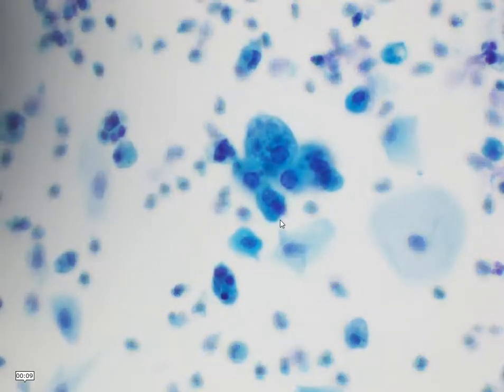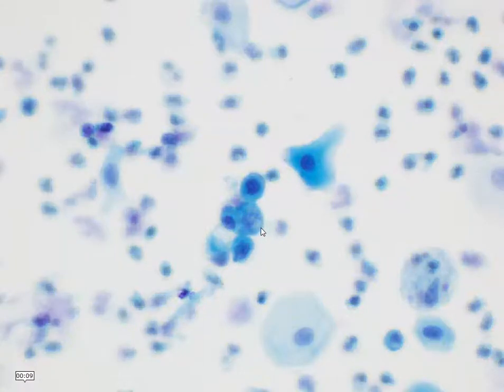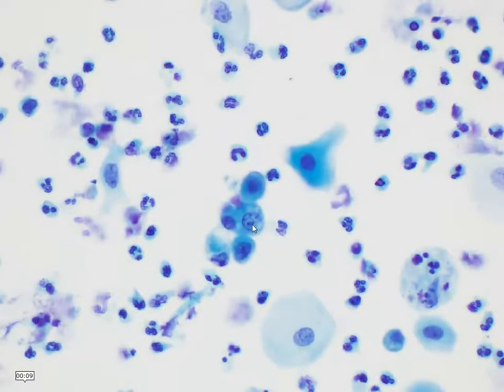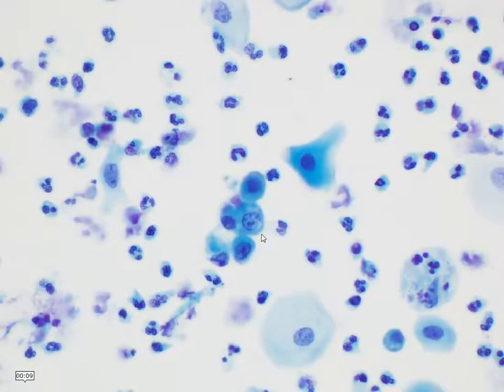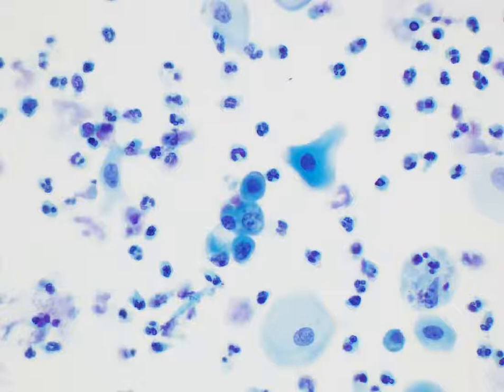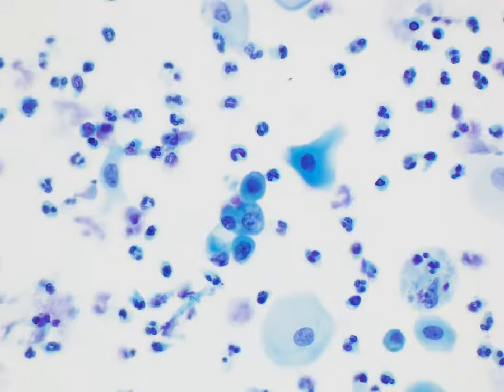Finally, the last group shown here has quite an abnormal nucleus for an endometrial cell. We can definitely see a prominent nucleolus here. So overall, the features seen here are those of atypical glandular cells, endometrial in nature.